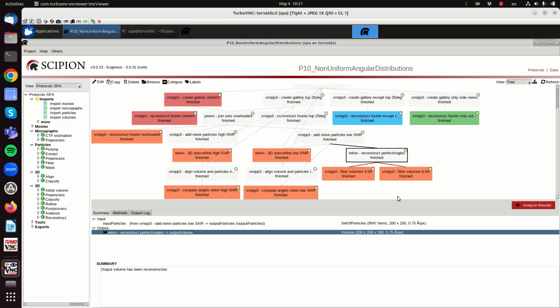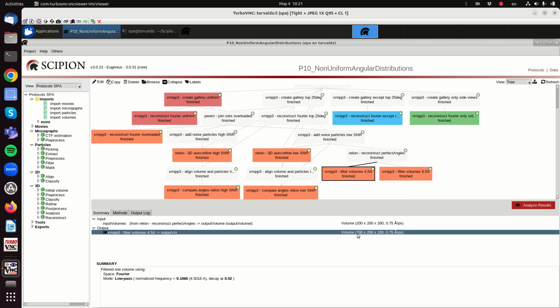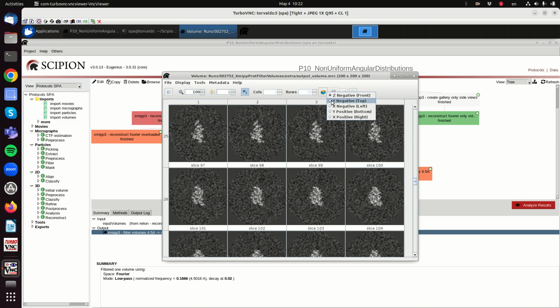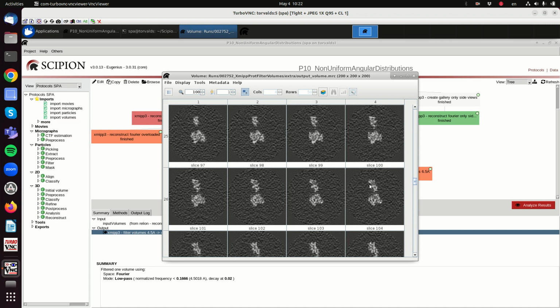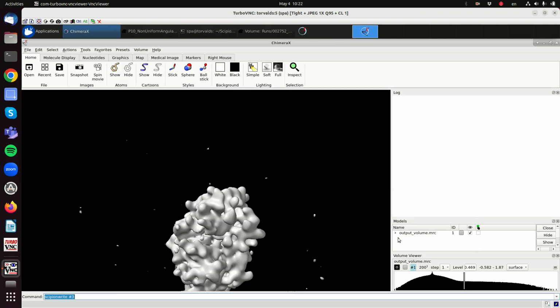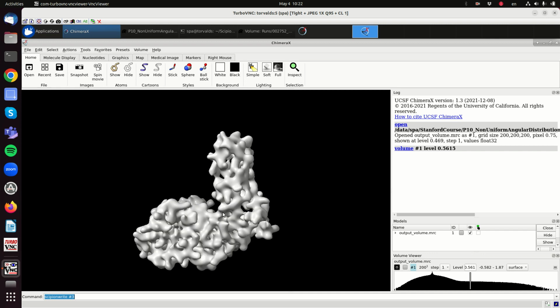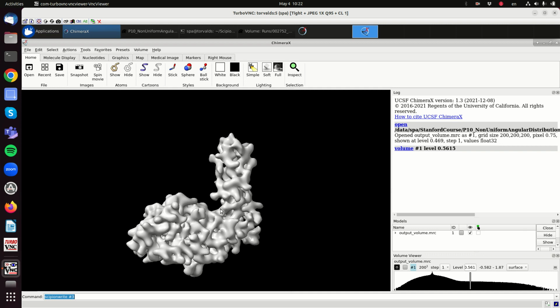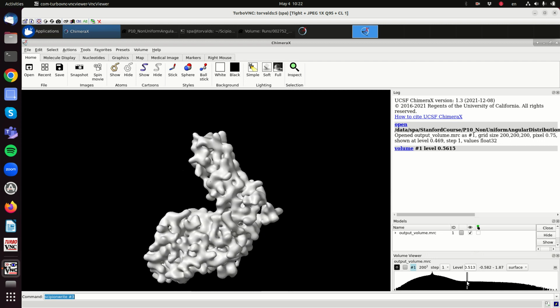But if we filter, for instance, at 4.5 angstroms, we see the structure pretty well, and it doesn't seem to be particularly elongated. We can check that in 3 dimensions. Yeah, we have a lower quality structure, but that is expected because we have much more noise than in the other case with a very high signal to noise ratio. So we cannot recover the high frequency component so well, but otherwise there is not any particular elongation.